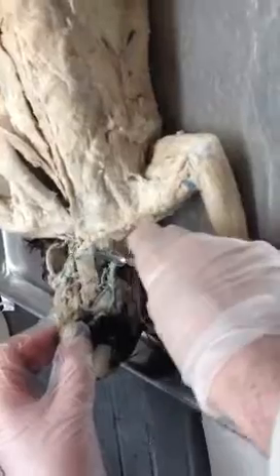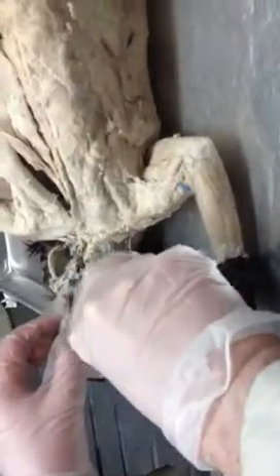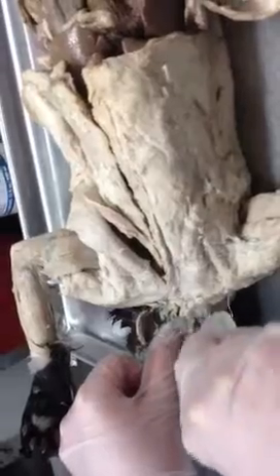The big strap in the middle here is called the sternohyoid — it goes from the sternum to the hyoid bone. Then lateral to that, you have two straps of muscle: the sternothyroid, which goes from the sternum to the thyroid cartilage of the larynx, and then the little loop, which is called the thyrohyoid.